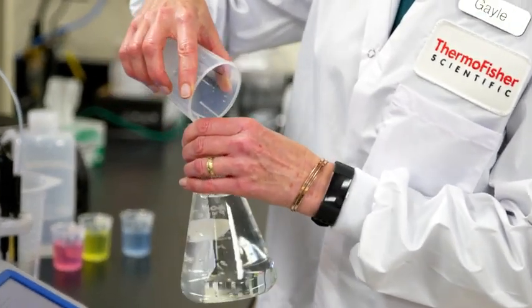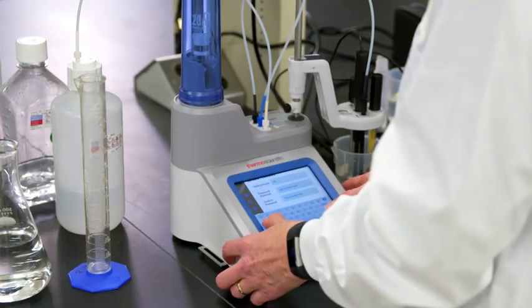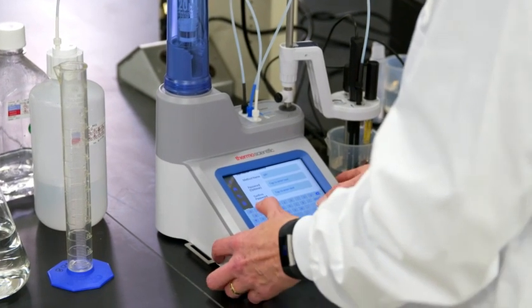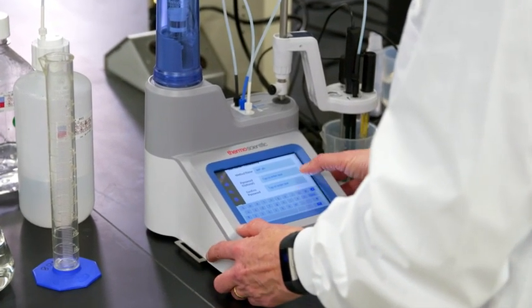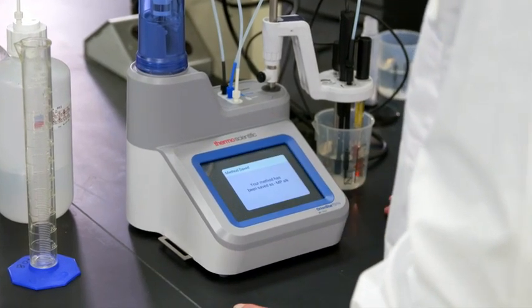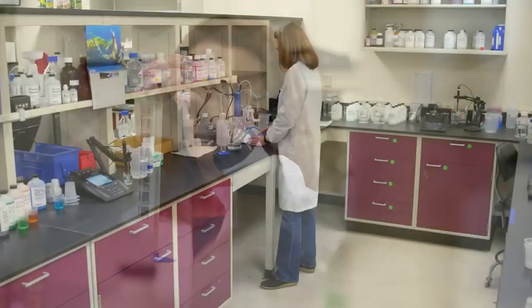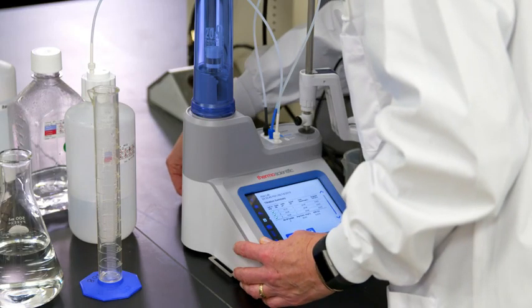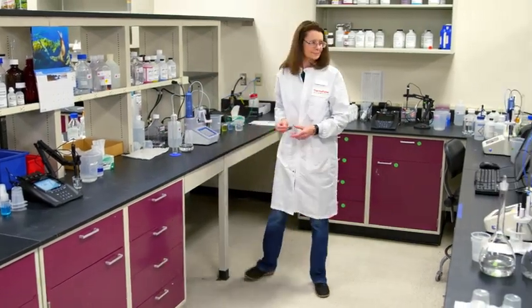So I just did alkalinity of water using the T910 pre-programmed method. I can also modify this method to run M&P alkalinity, or to change my titrant concentration, or use a different acid. The titrator allows me to save up to 10 methods, and I can import and export them with a USB stick.